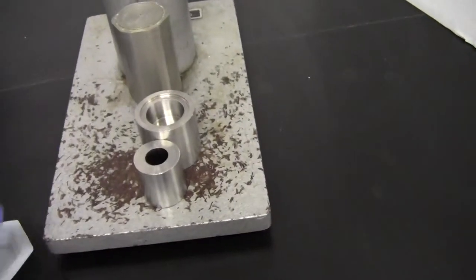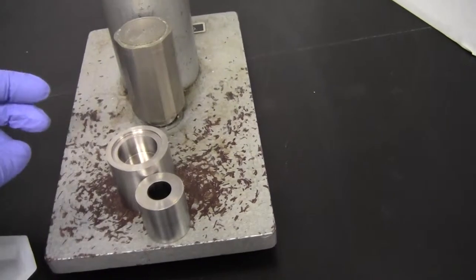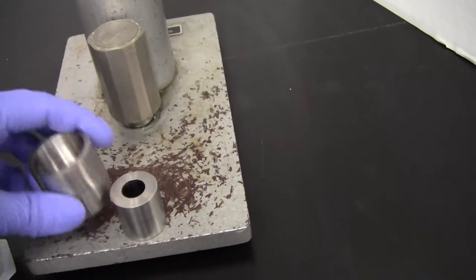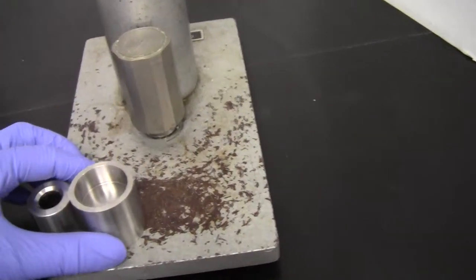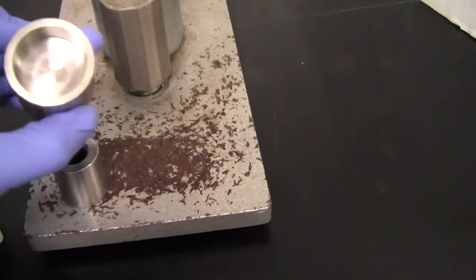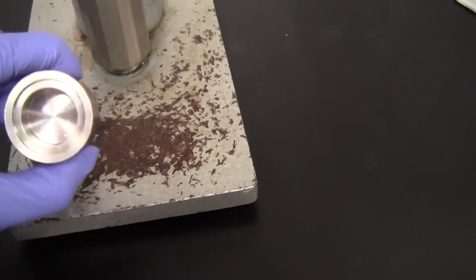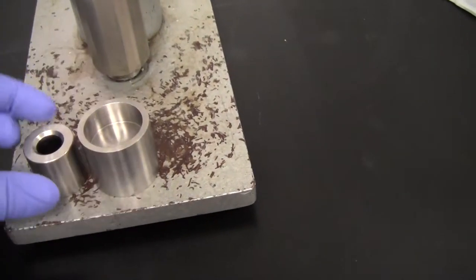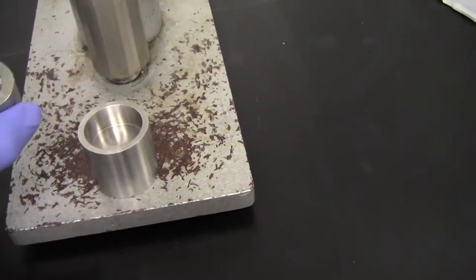Then you want to come back here and just assemble this way like so. Okay, so there are two pieces here. One that looks like this on this side and like this on the other. So you want to orient it this way and the following one like so.